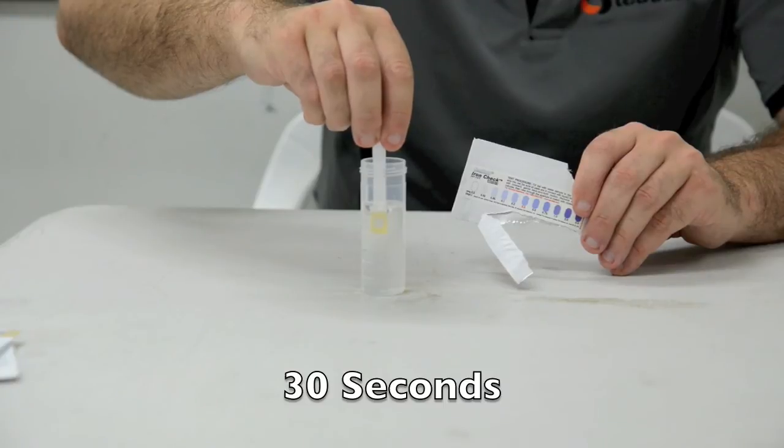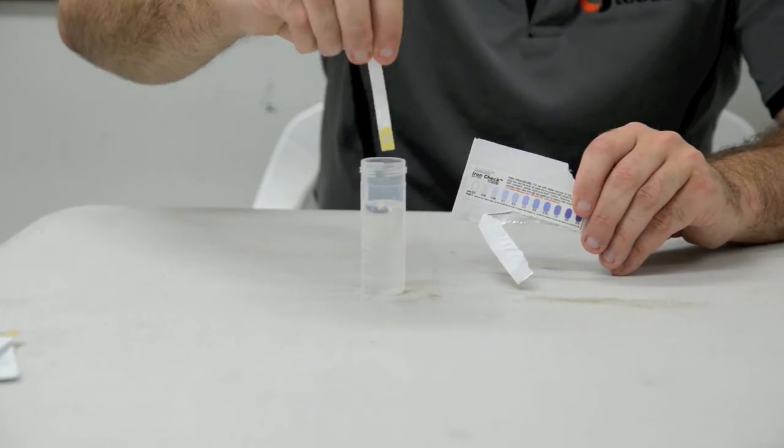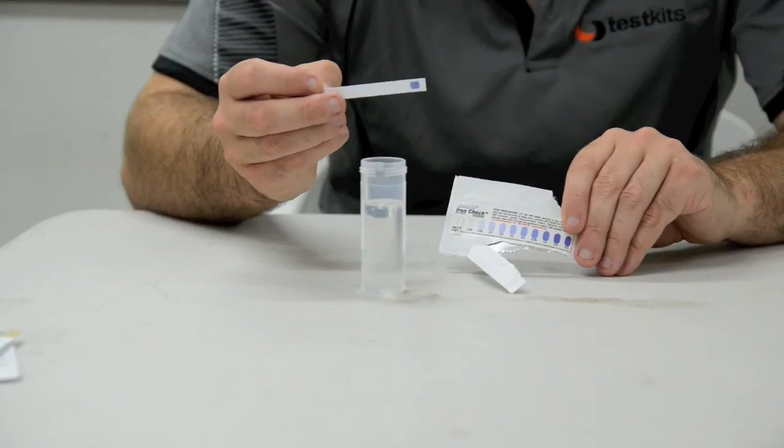After 30 seconds, remove from the sample. Wait 2 minutes, put it up against your colour chart and get the closest reading on the chart.